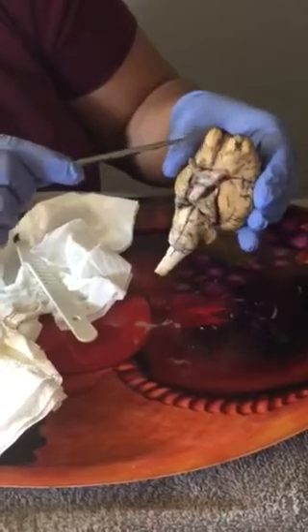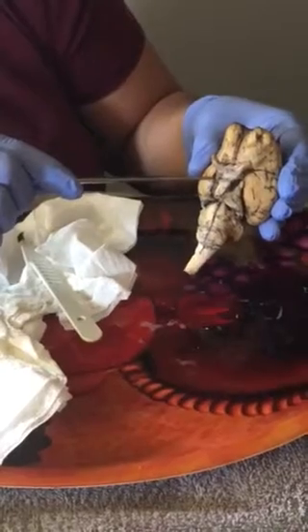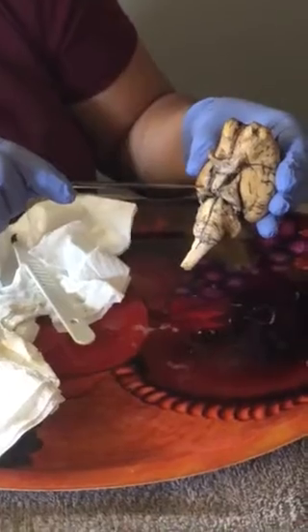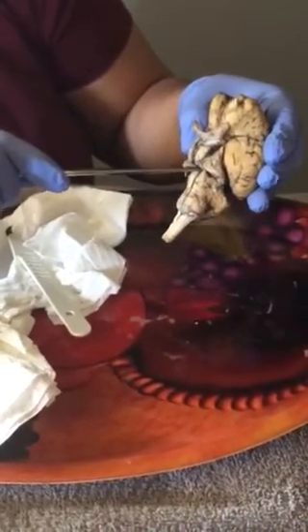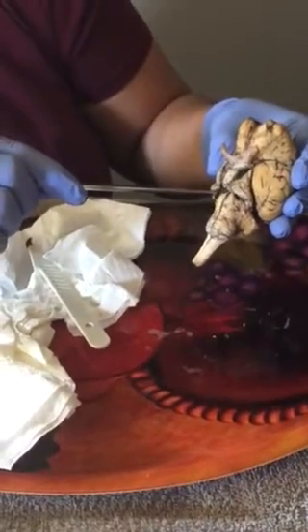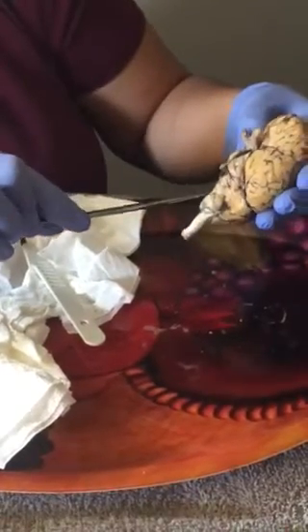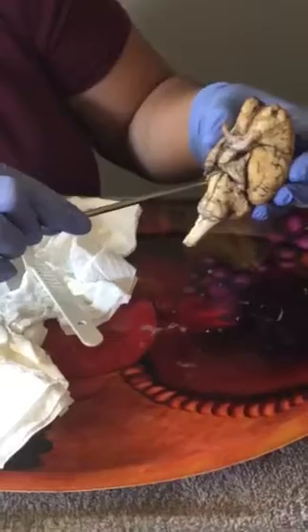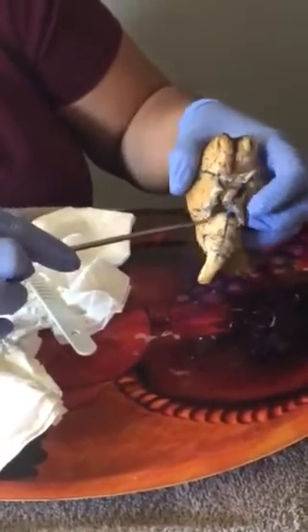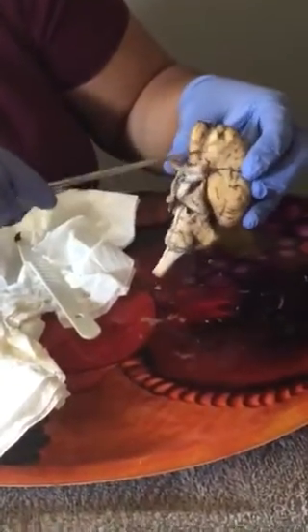On the other side, under olfactory, we have oculomotor right here. Right below that, we have the trochlear. And then we have abducens. Out to the side is the vestibulocochlear, hypoglossal, and then the very last one, all the way towards the bottom here, I will lift it, is the accessory. So those are the 12 cranial nerves connected to our body.